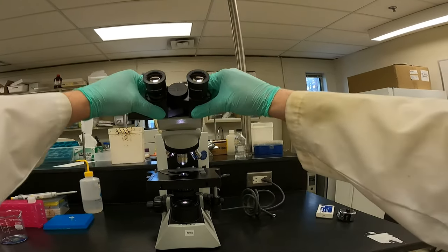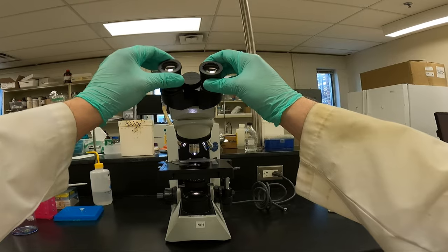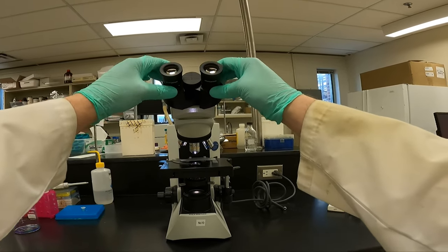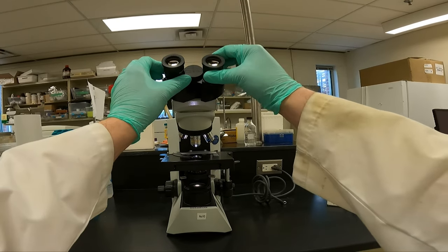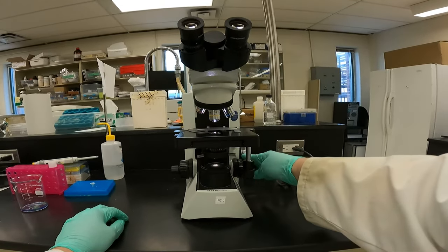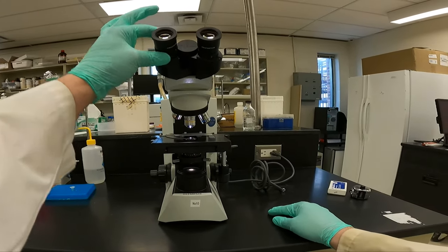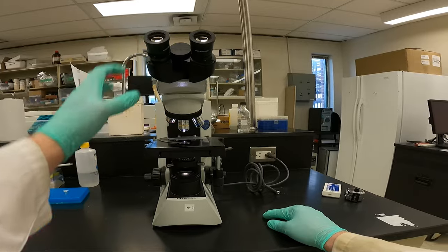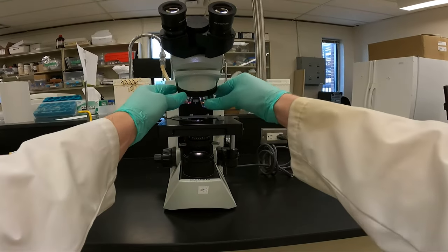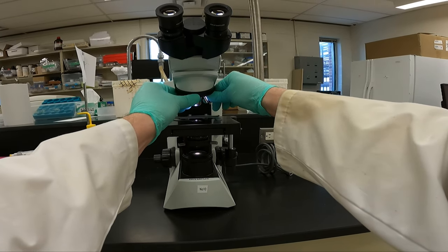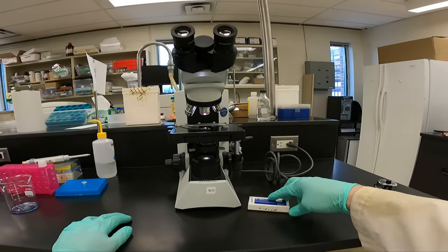We have our binocular ocular lenses here. What you should do is you put it in focus with the right side one and then adjust it with the left side one to make sure it is even for both eyes in terms of focus. Again, we always start at lowest magnification.